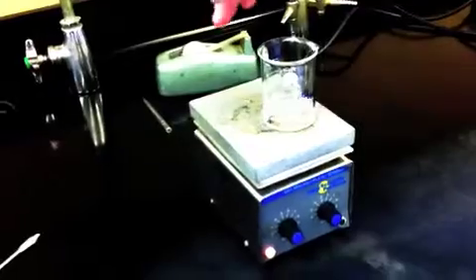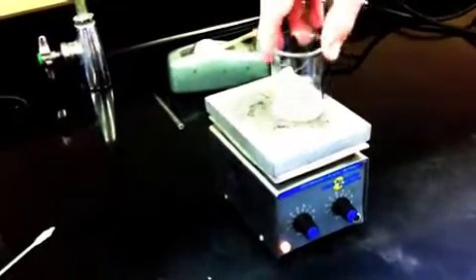You can see that the ethanol, when you heated it up to about boiling temperature, it's all dissolved in there, right? Looks like it's all... Yep, there we go, all dissolved.